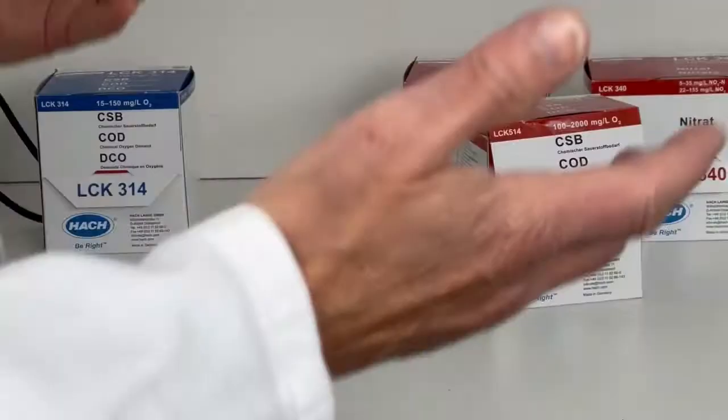Hello, my name is Dr. Sabine Duret-Jonek and I'm responsible for the research and development department at PPU Umwelttechnik in Bayreuth. I would like to show you today our laboratory. We are running our own laboratory at PPU, as it is very advantageous for our clients as well as for us, because we try to build knowledge about the typical wastewater parameters you can analyze in the lab.